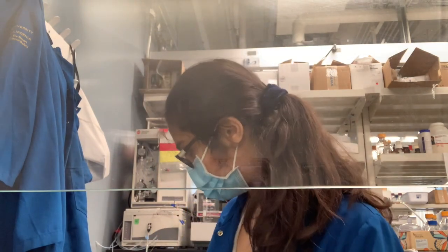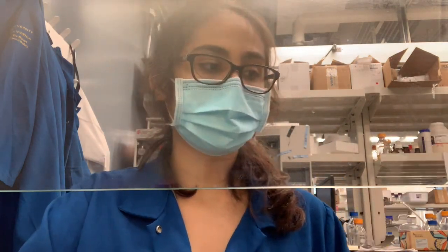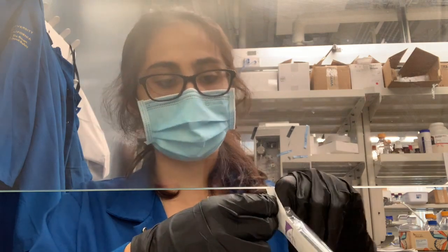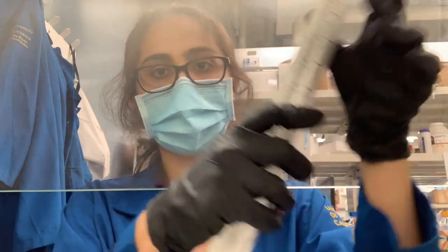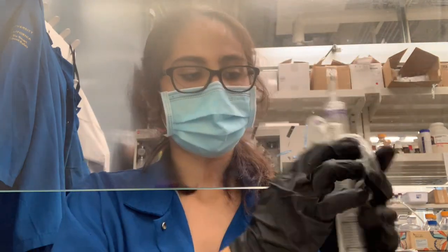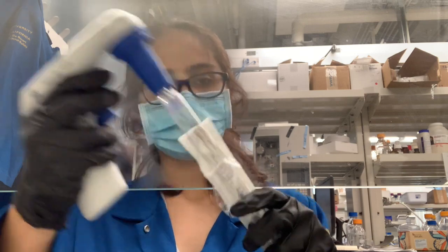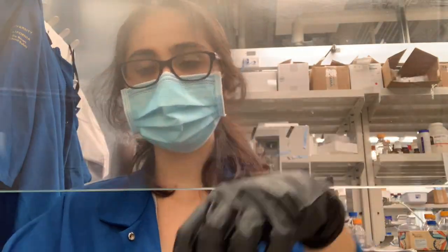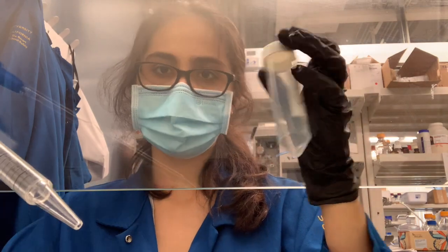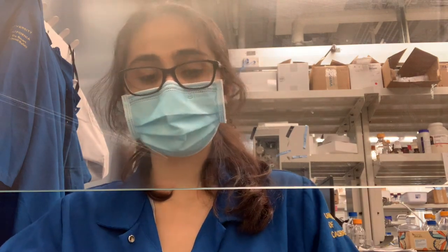The first step is I'm going to dilute them to 0.5 optical density. To do that, I will take out 40 mils from each of the cultures and put it into a centrifuge tube. I actually take out two 40 mil sets from each of the cultures. I use a 50 milliliter pipette — you can find those under the scale — and then an electrical pipetter, which is above Mauricio's desk. It is important that you charge it once you're done using it.